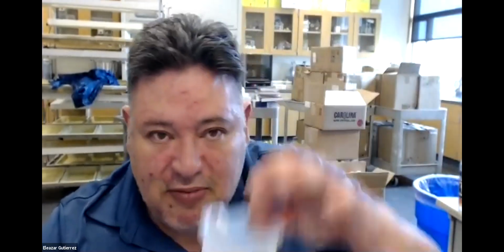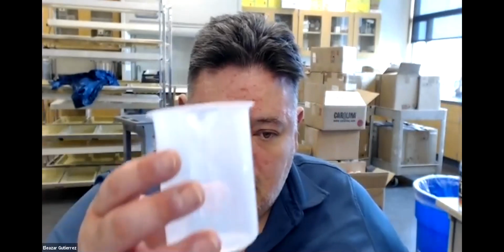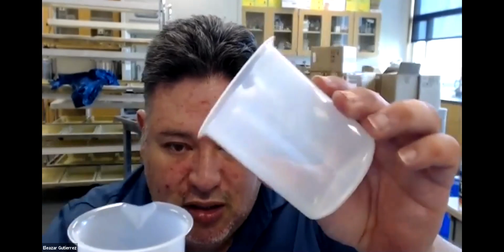Now you're gonna take 5 milliliters of this solution and you're gonna put it into a second beaker. To this beaker, you're then going to add 250 milliliters of water, and that's going to be your 0.24% sodium bicarbonate solution, okay? Now what? Now you take your first beaker, you rinse it with distilled water, okay? And you're gonna put half of this 0.24 over here, half of it.